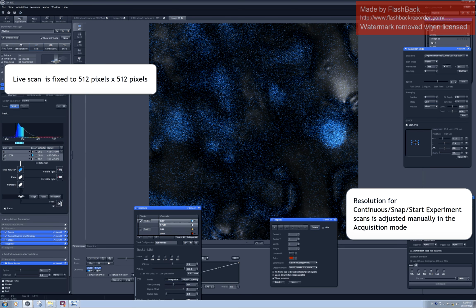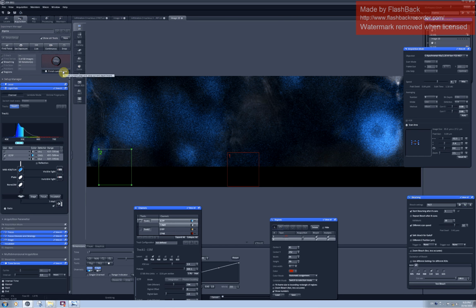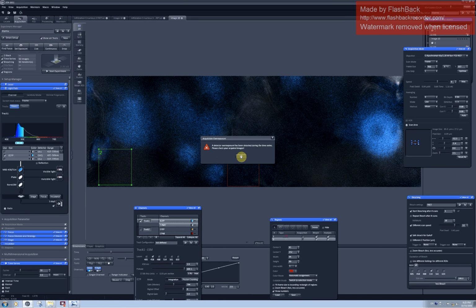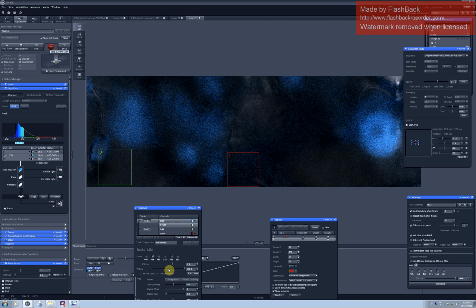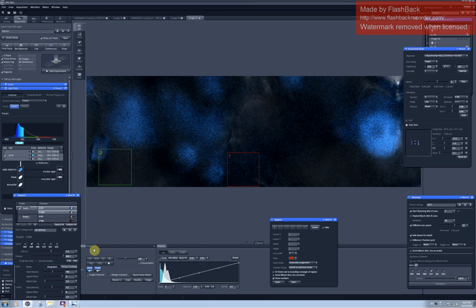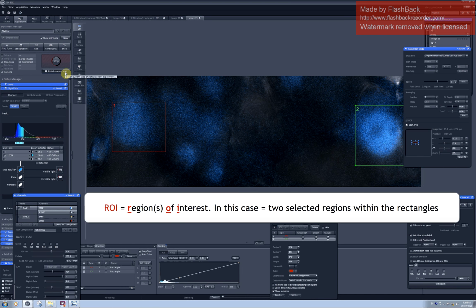So if I go to live scan and then select regions on the image which I obtained here, and then go to start experiment, the regions are at completely wrong places. Okay. But if I click on continuous, and select regions on the image where I have the same resolution which I will use for start experiment later on, then the ROIs are in the correct places.